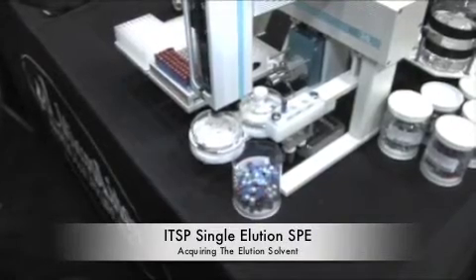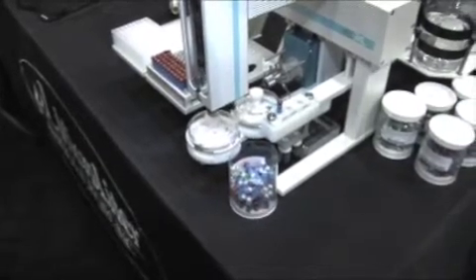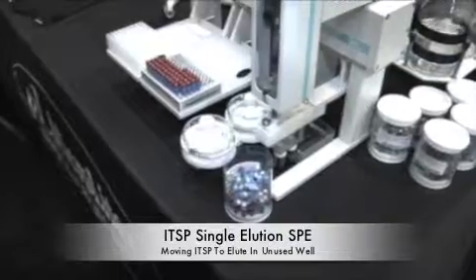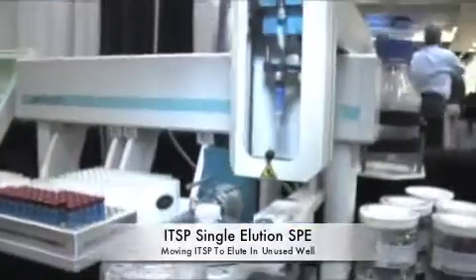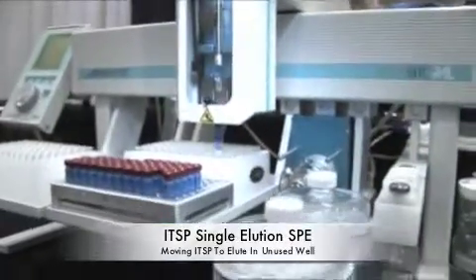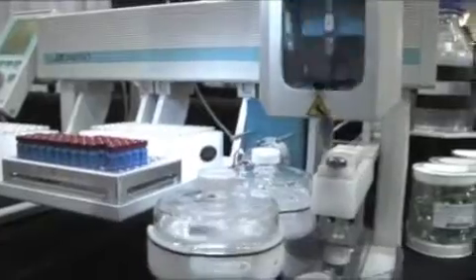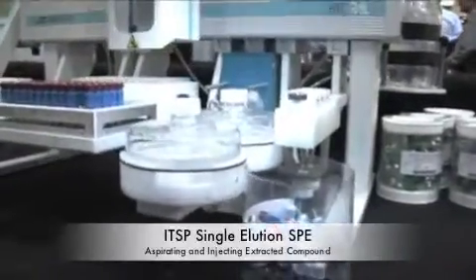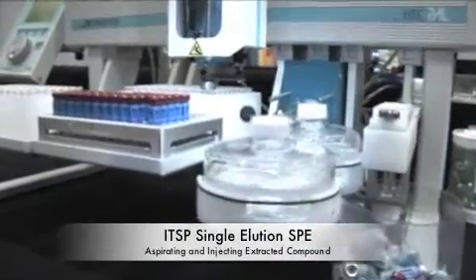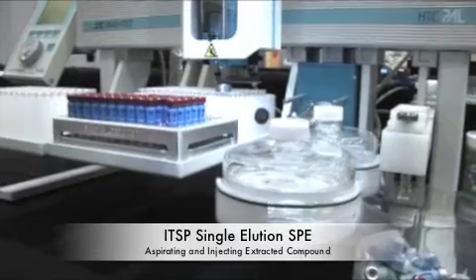We see generally solvent reductions of 70%. The labor is obviously non-existent except for prep of the actual supernatant if you need to do that. We found urine to be a great platform. Blood and plasma and serum has to be cleaned up before we can use it. It's good for any kind of water analysis, things of that sort. QA/QC of raw material and finished goods is another application.